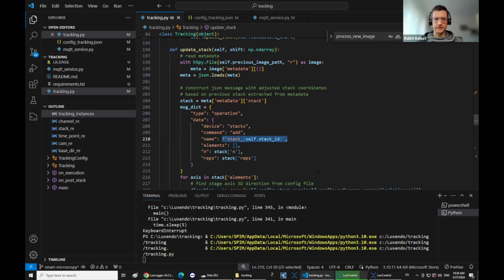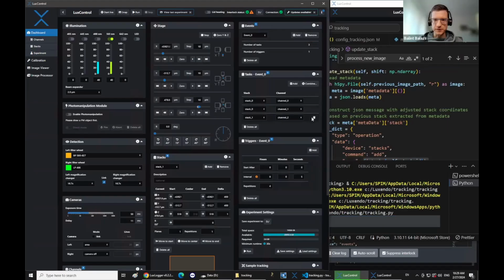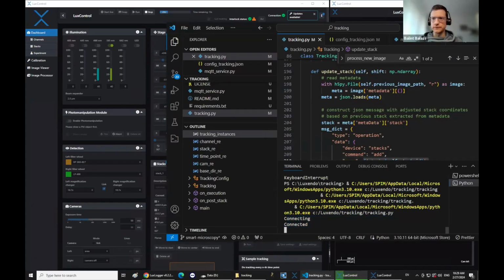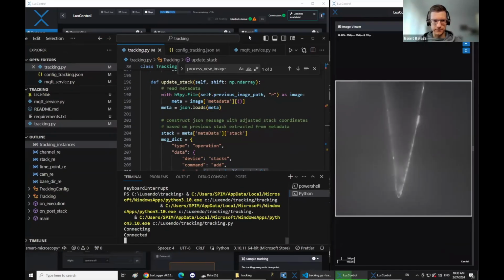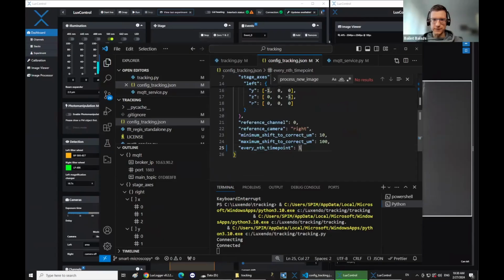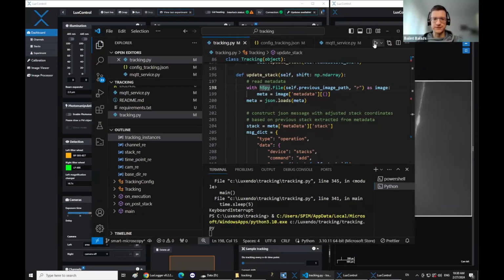Yeah, I mean, if we run it, then basically it just connects first, and I just have a time lapse. Maybe we just do one stack for 4 repetitions, and I think the first time point just finished now. Yeah, I think I just messed up the config, because here I'm only recording the left camera, but I have the right camera as the reference. So I start it over. But yeah, I think we're out of time, so we don't have to look at it.